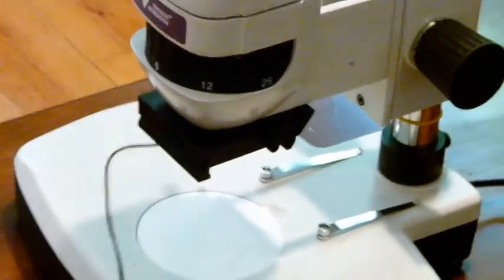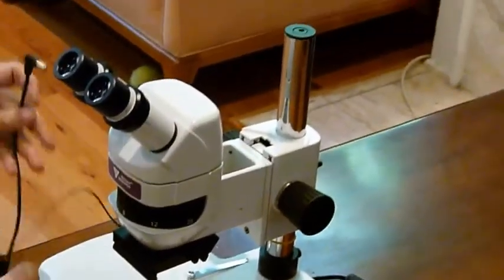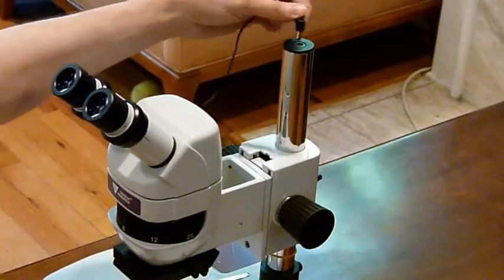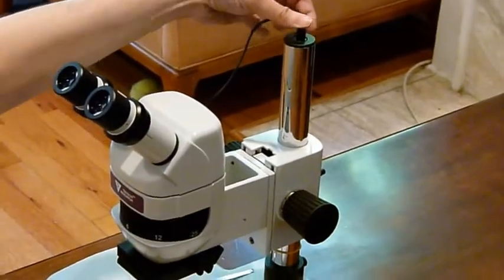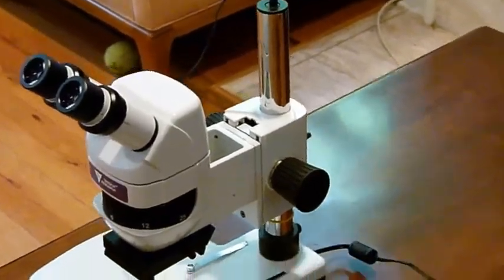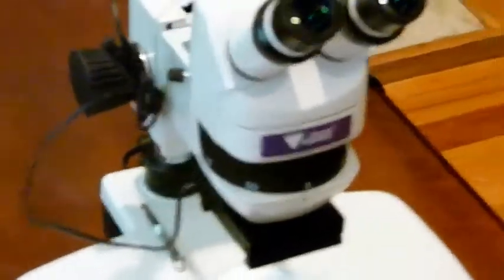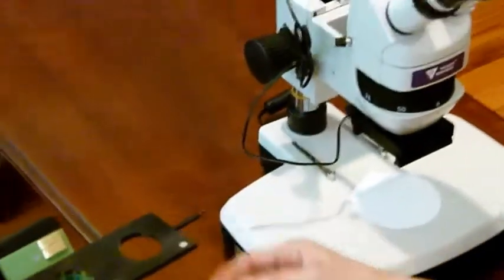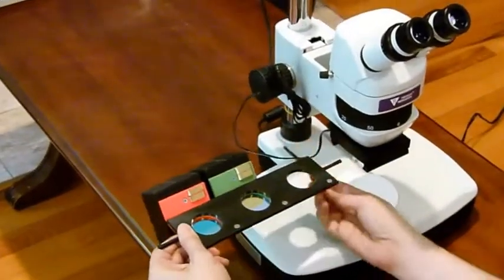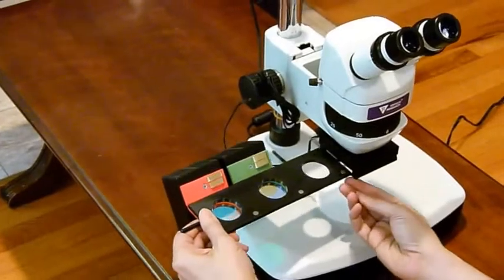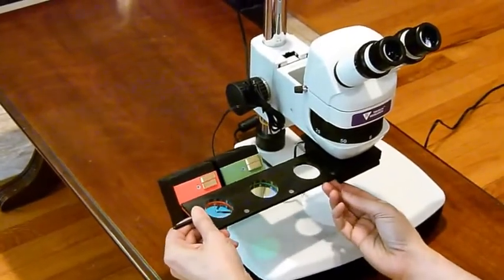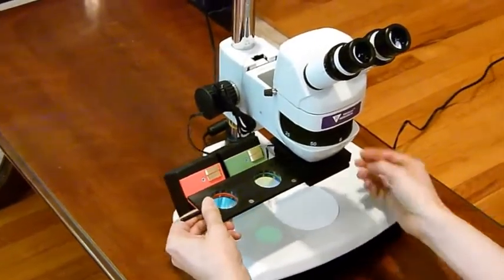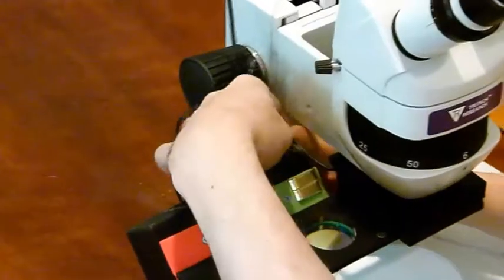And then here's the power cord. That plugs in up here. Now you're all set with that. Now here's the slider and the modules. That just goes right in the slot here. And you are all set and ready to go.